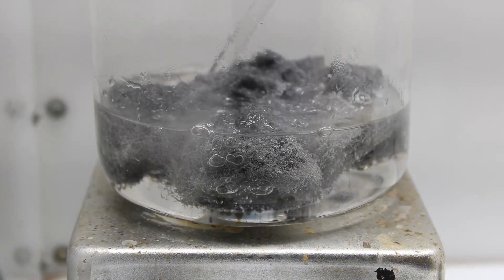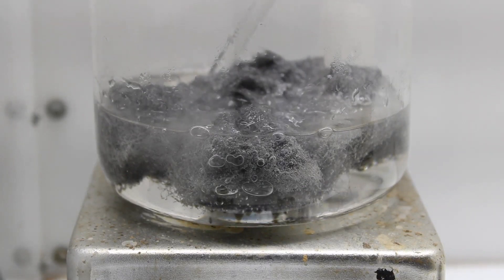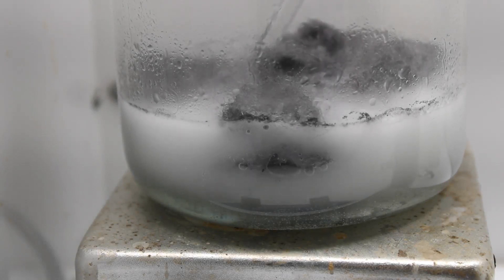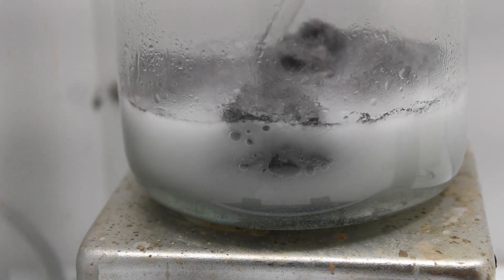Complete dissolution usually takes 10 to 20 minutes, and during this time, substantial quantities of hydrogen are released. As such, it is advisable to work outside or in a fume hood at this stage.